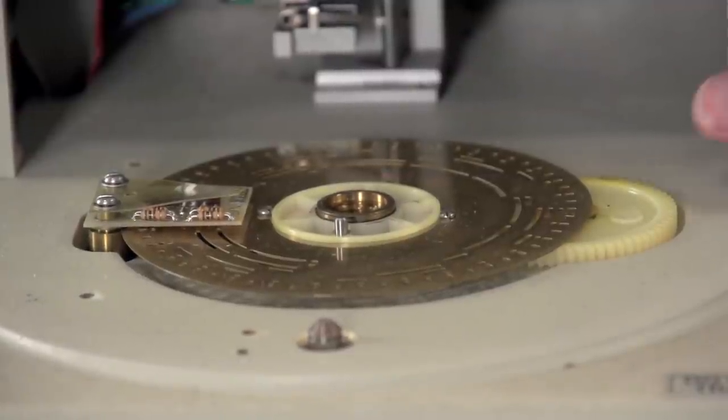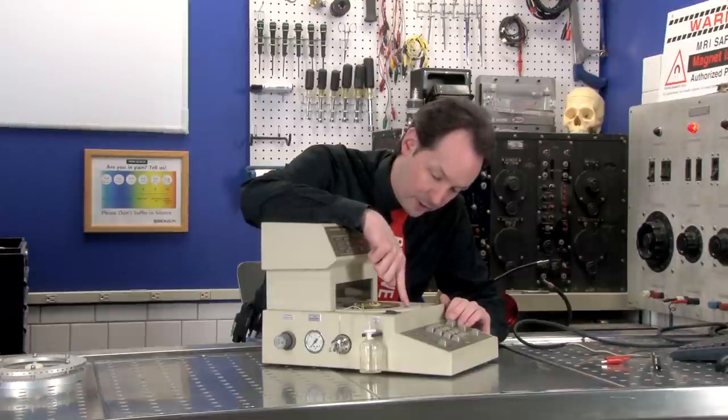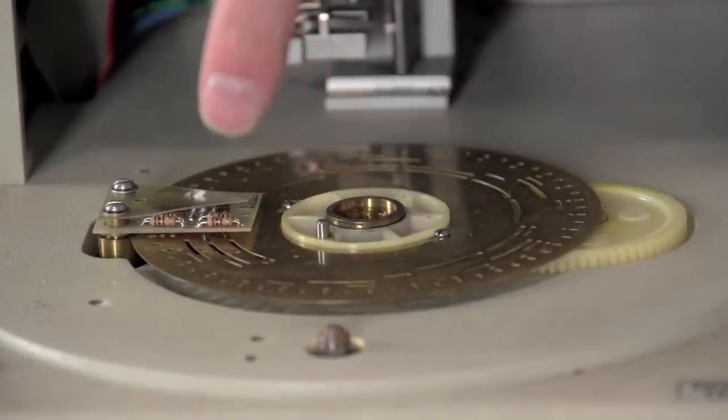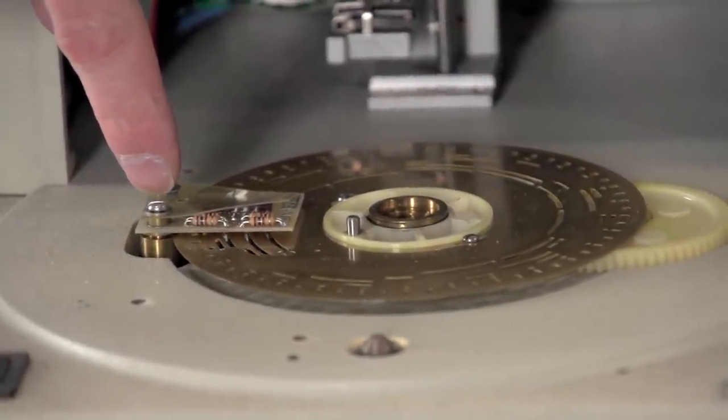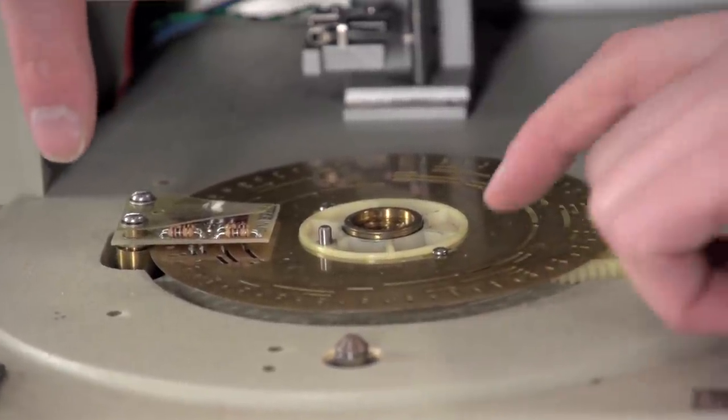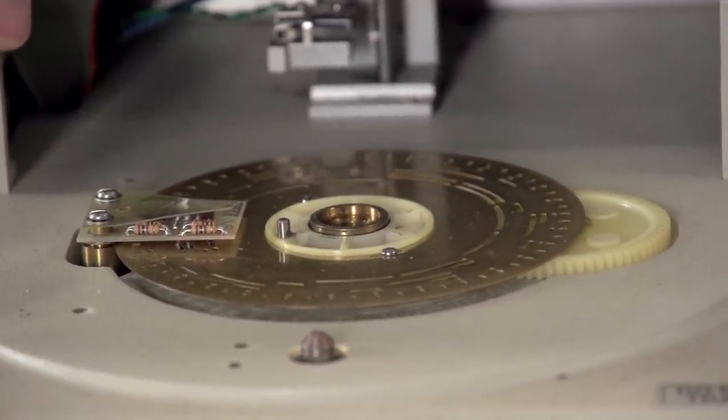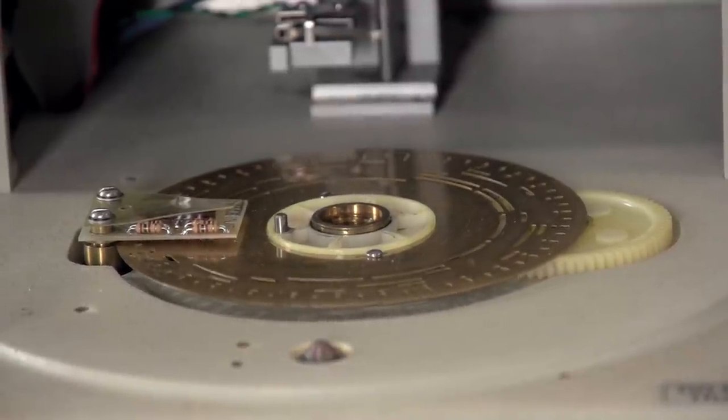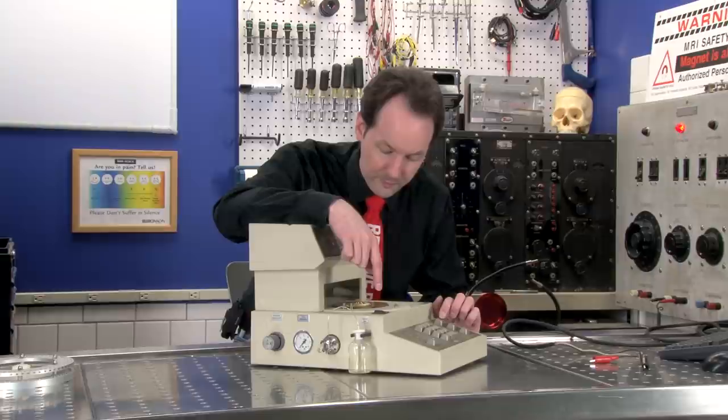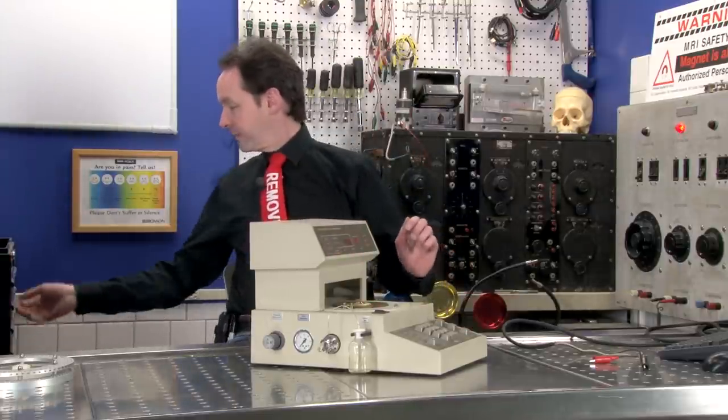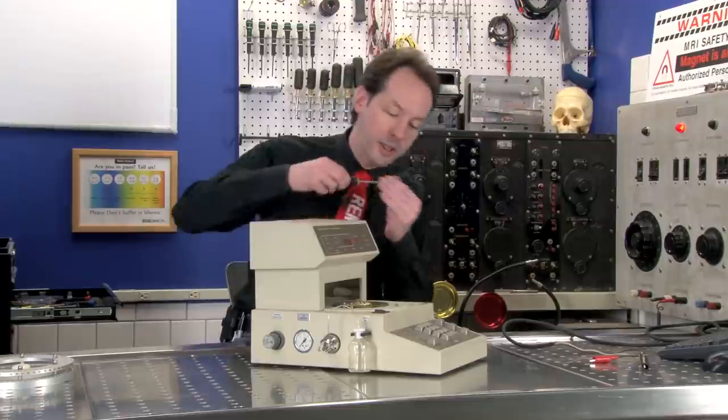I gotta get my cable. We got a cool bit here. This is a rotary encoder right here. Big solenoid gear drive. And this here is a really simple rotary encoder etched into this brass disc. You can see these markings in that. And might be simple binary. Let's open it up and take a look. It might just be binary.